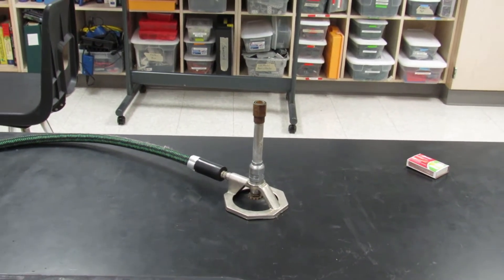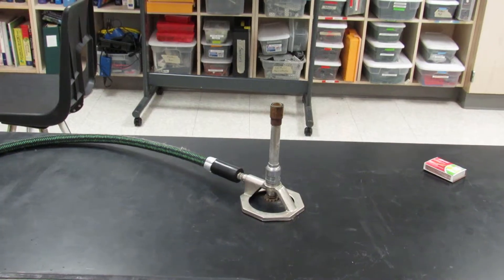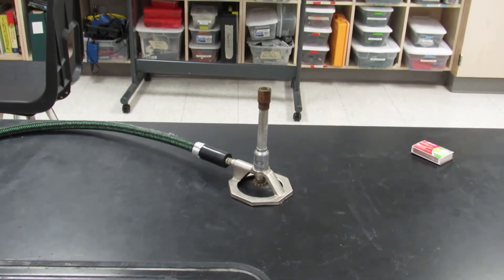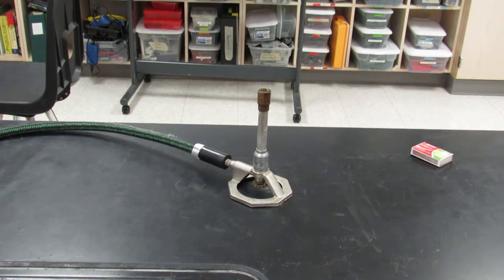What we have here is the Bunsen burner. You're going to need matches, and you want to make sure that it's sitting on a secure surface just like it is here.